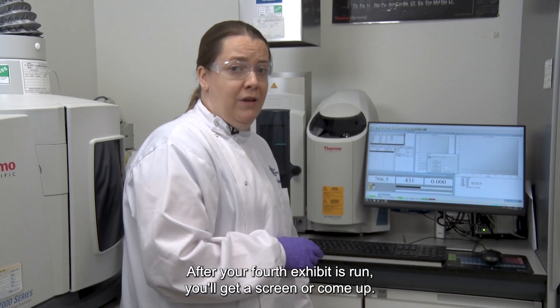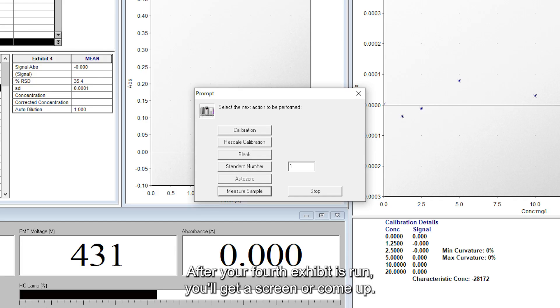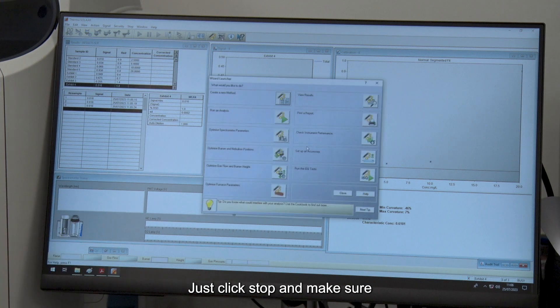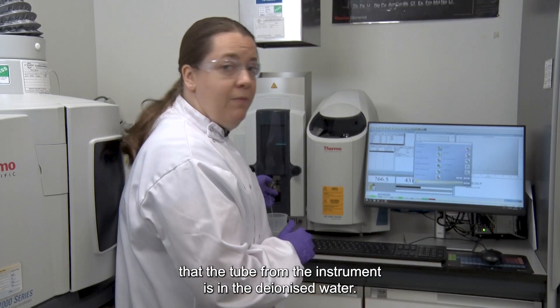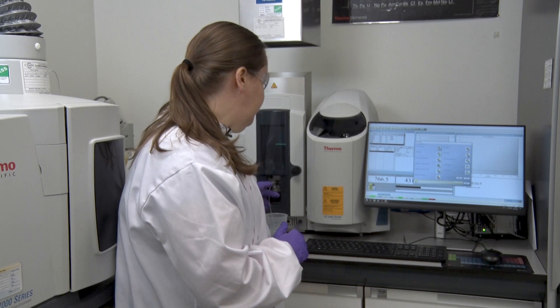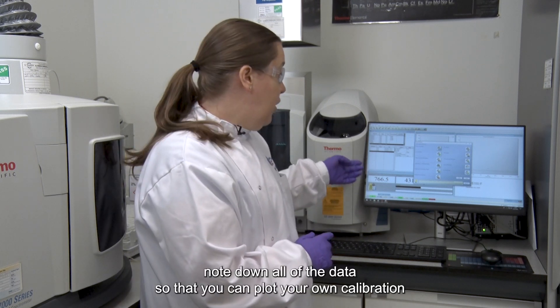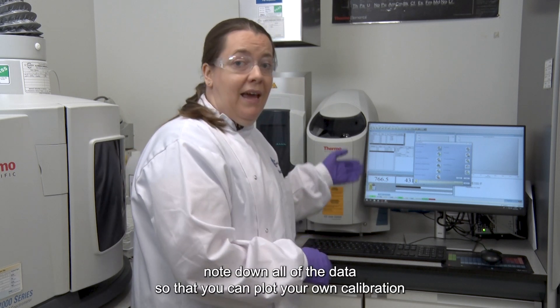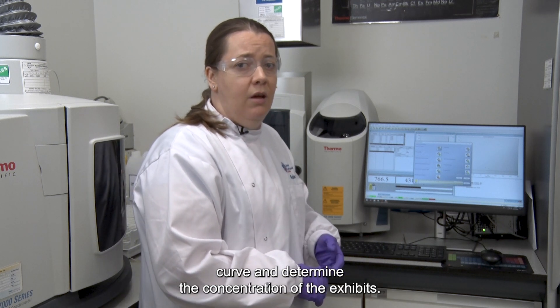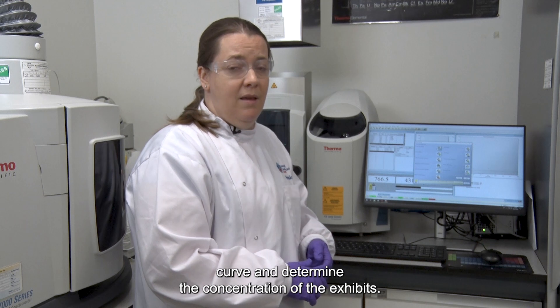After your fourth exhibit is run, this screen will come up. Click stop and make sure that the tube from the instrument is in the deionised water. You can now note down all of the data so that you can plot your own calibration curve and determine the concentration of the exhibits.